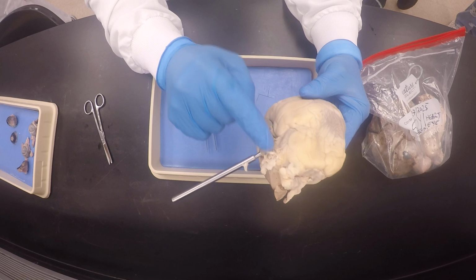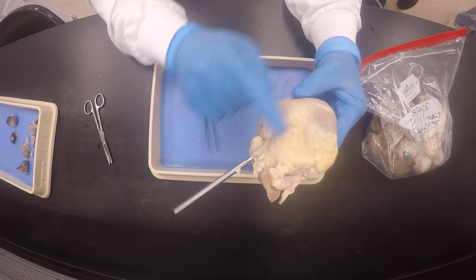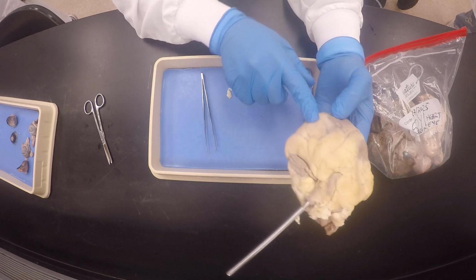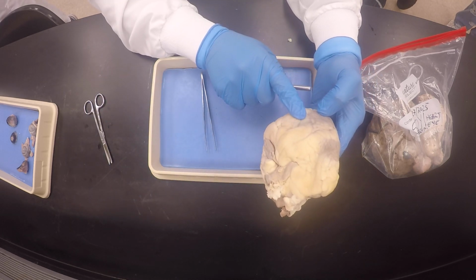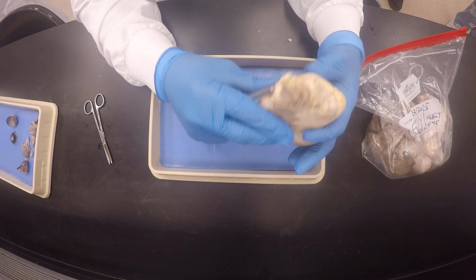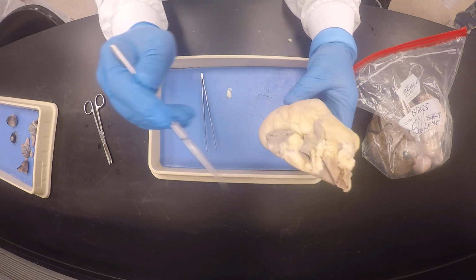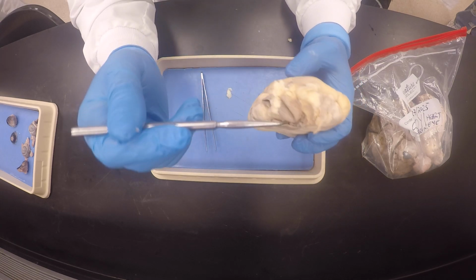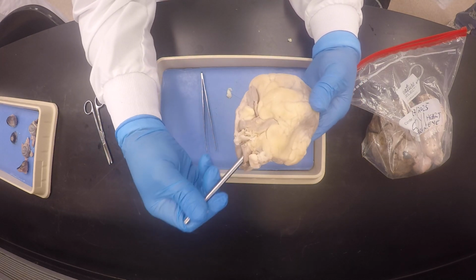But do you see how you know that this is definitely the pulmonary trunk? Do you understand? Because it's going here to the right side, and this is the left ventricle. If I were to go through the aorta, I would come out here. You know what I'm saying? And we will do that. You see, definitely this is the aorta. You can see how it's already starting to curve to the left. Is it just me or what? You see what I'm saying? Here. So I'm not going to poke my left side again.